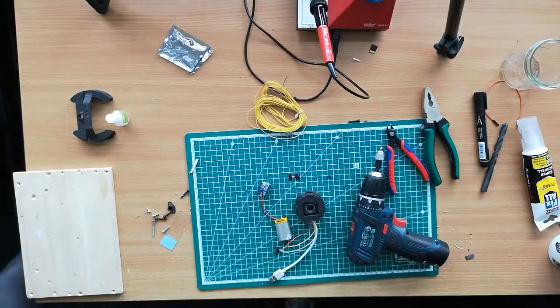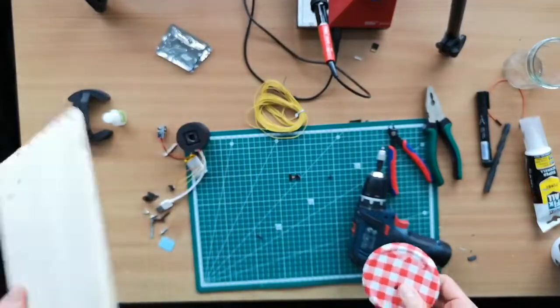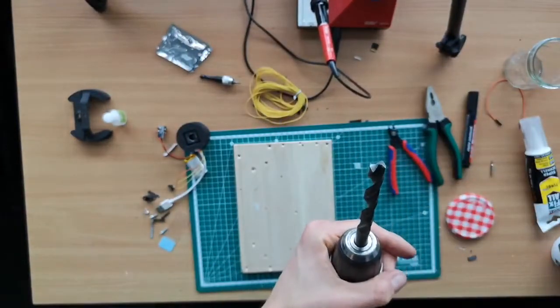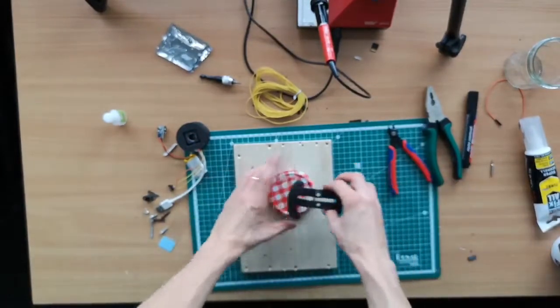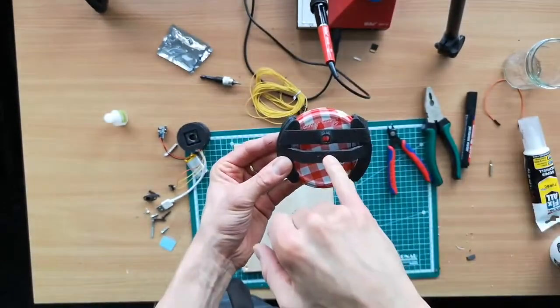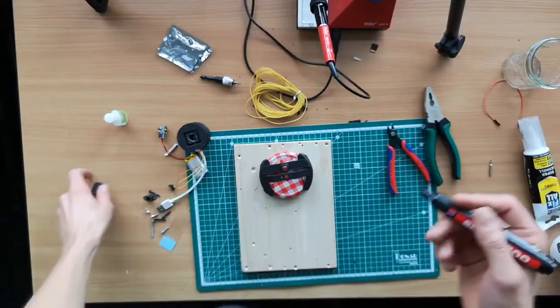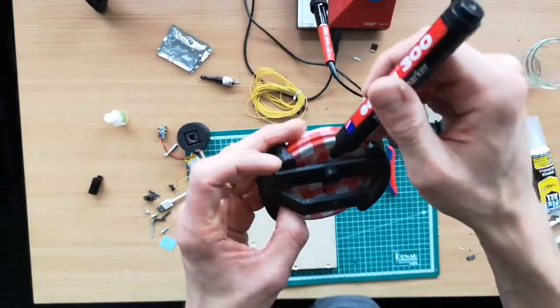So in the meantime, we can make sure that this lid here gets a hole so that we can look through it. For this we use a wooden board, and then use the power drill with a large drill bit. And then we are using this as a template so that we know where to drill. So this is the illumination mount for the Toslink fiber. The center has to be, of course, in the center, and then this here is the hole for the LED on the ESP32. So we use again our pencil or whatever marking tool you have, make a mark in the center, and then also right here.